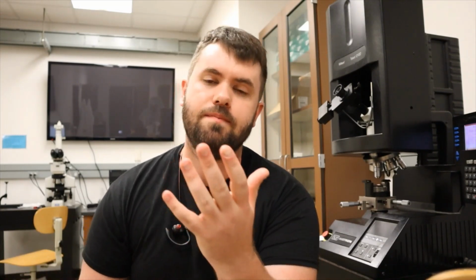So in this lab, we are going to do two main tests. We're going to do a micro hardness test on our samples. We talked about solid solution strengthening at the end of the lecture, and a good way to tell the effect of this strengthening is through a micro hardness test. So we are going to take our samples and use the Knoop indenter this time as opposed to the Vickers. If you remember, Knoop is the elongated diamond indenter, but we still use the same hardness machine to do it.